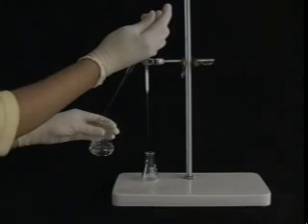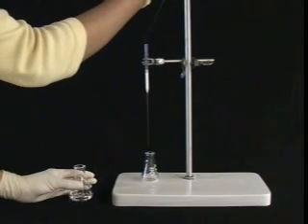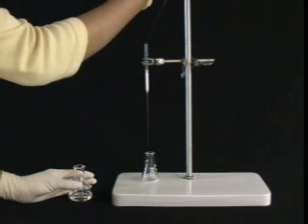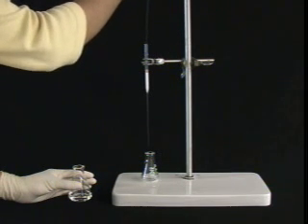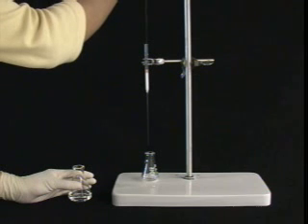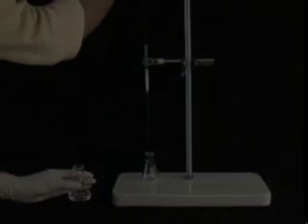To run the column, place a collection flask or a test tube underneath the pipette. And use another pipette to add solvent to the top of the column. Keep adding solvent until your compound has come off of the column. Make sure you don't let the column run dry.